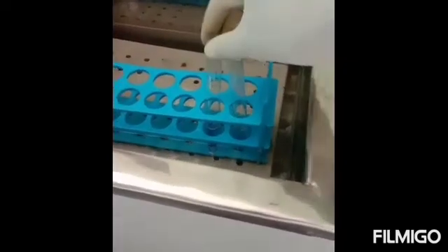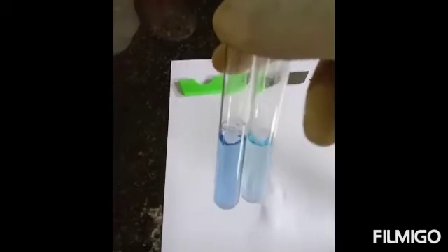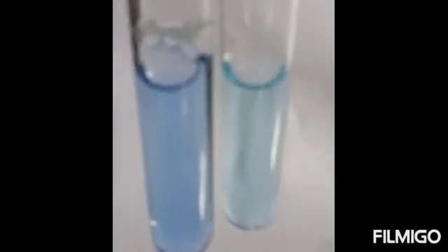After 5 minutes at 37 degrees Celsius, you can see a purple color in the tube in which protein was taken. There is no color development in the test tube in which amino acid was taken. So protein only gives a Biuret positive reaction, while amino acid gives a negative Biuret response.